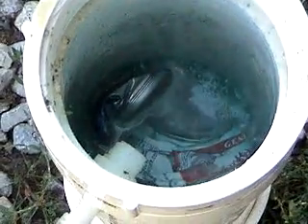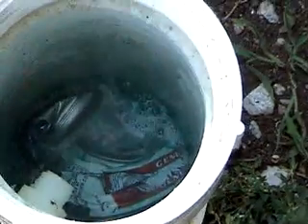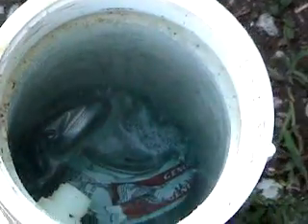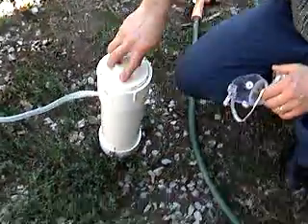It's starting to get going now. We can see some bubbles developing in there. We can see like a vapor coming out of the can. It's killing the camera man slowly. How long has it been in there? A while, probably about two minutes, two to three minutes. You can turn around this way if you want. Okay, I'm going to go ahead and screw the cap on. We'll see how long it takes to fill this up.